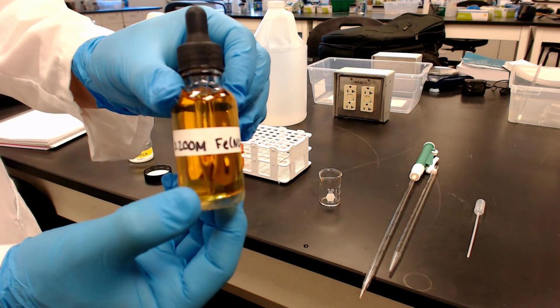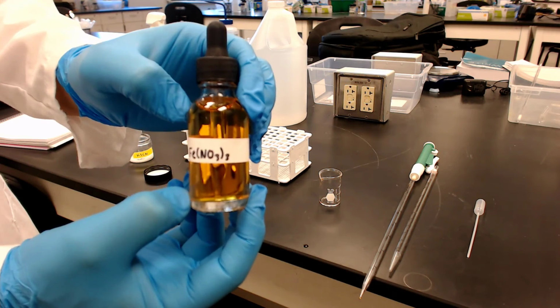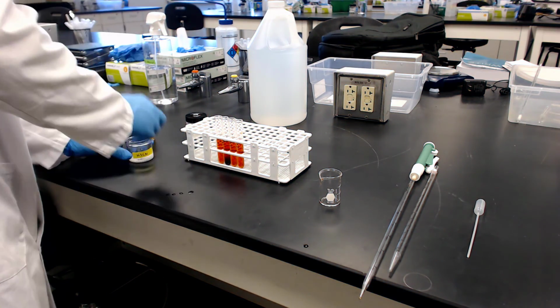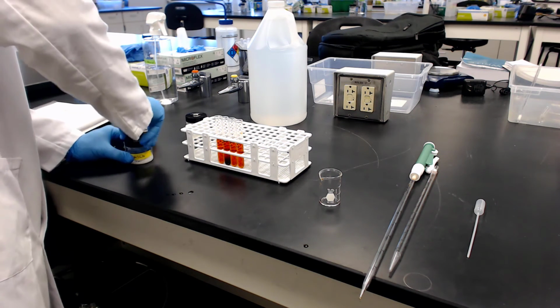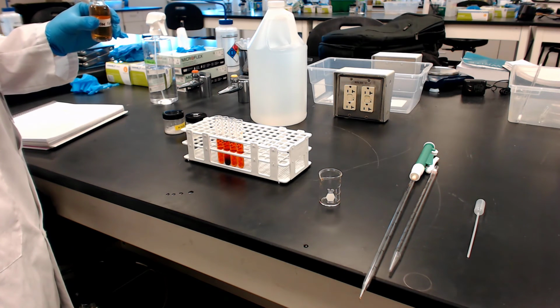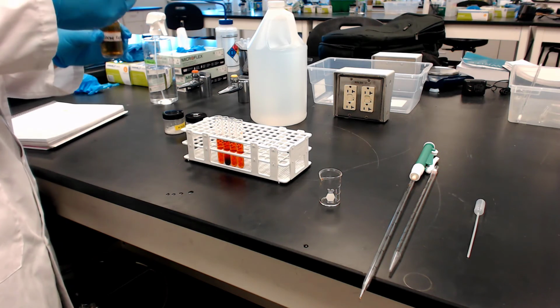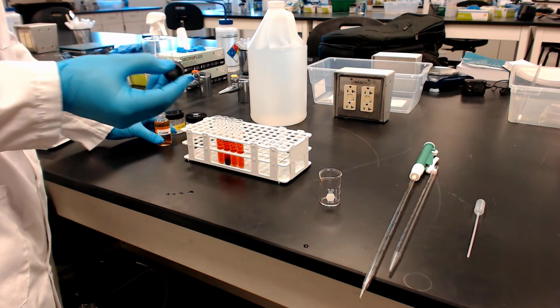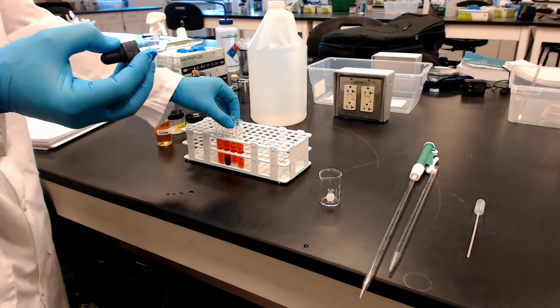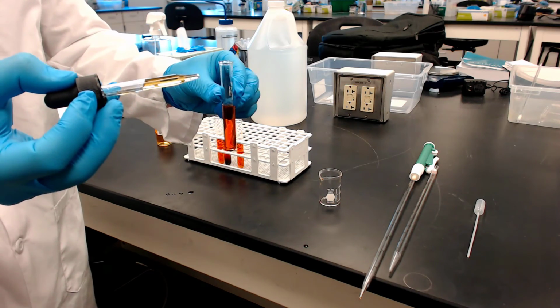Now we're going to do something similar. We're going to add more iron nitrate. Okay, so this would be tube 3. We are now on step 4. And again, once you add that, you're going to see a response. So you can see that second tube, what it's done. But now we're going to do the third tube. The stress is adding more of the iron. Remember, the nitrate is not part of the equilibrium expression. Let's see what it does to the equilibrium.